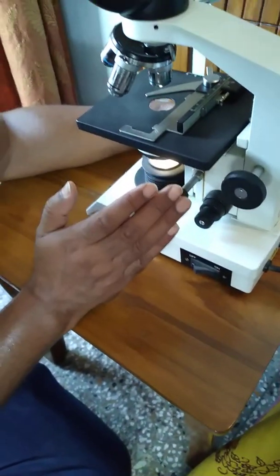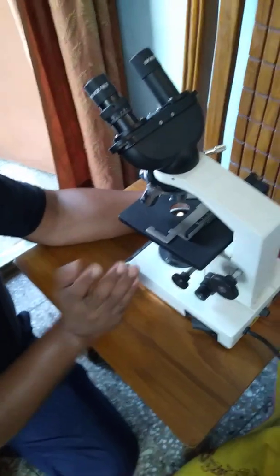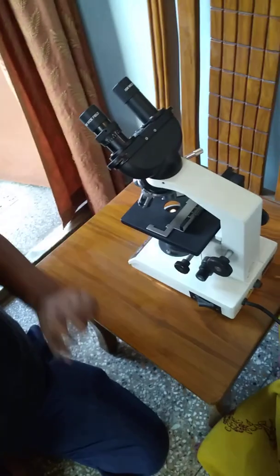You will have a little bit of difficulty in adjusting from the uniocular microscope to the binocular microscope, but the principle is the same. Rather, the binocular microscope has an advantage of a self-illuminating apparatus as well as binocularity of vision. Now, the most important thing is that I will be telling you about the resolution and the magnification.